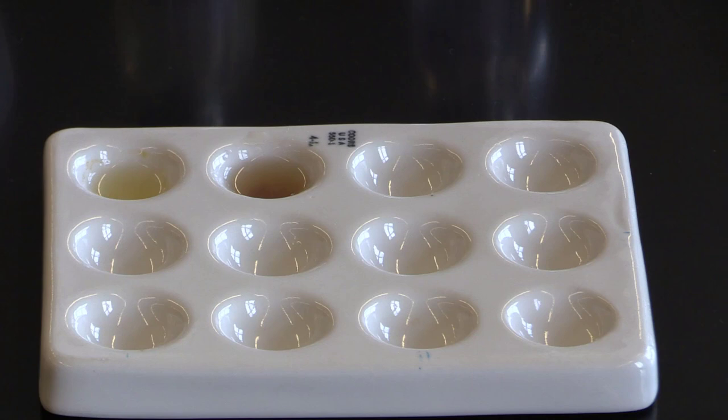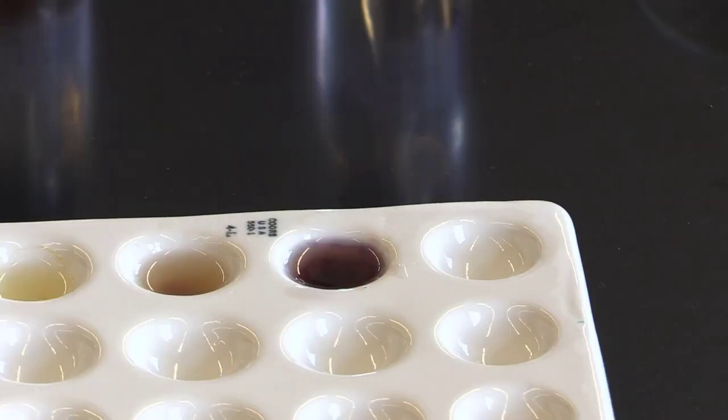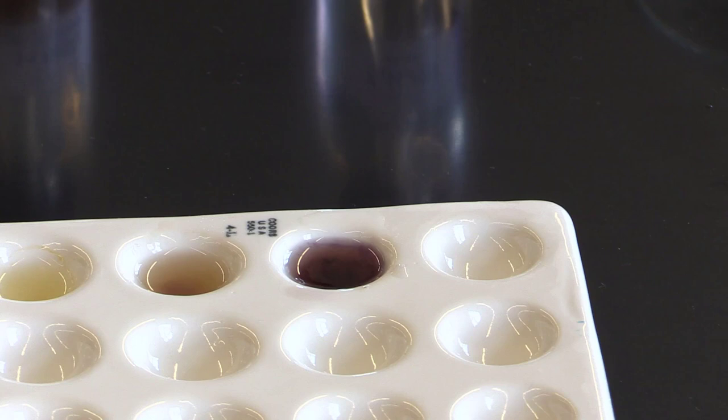Next we are going to take some expired aspirin and see what color we get. As you can see with the expired aspirin, we get a pretty dark purple there, showing that our aspirin actually decomposed back into salicylic acid.